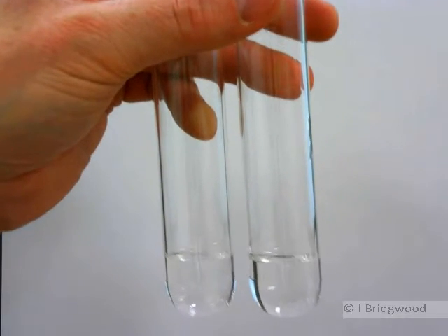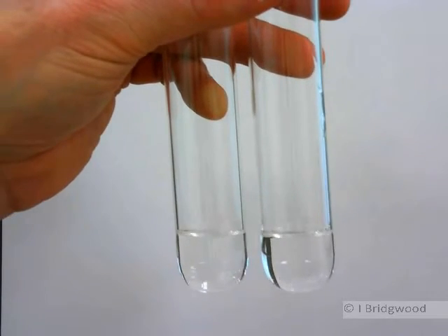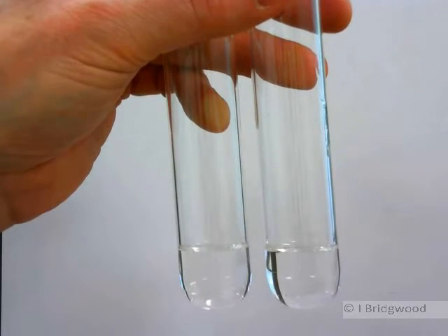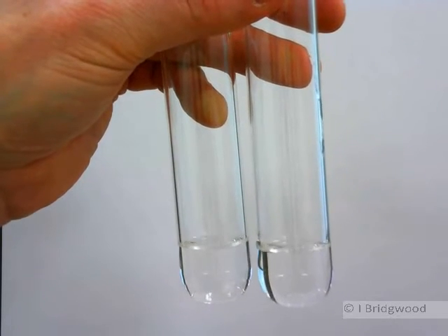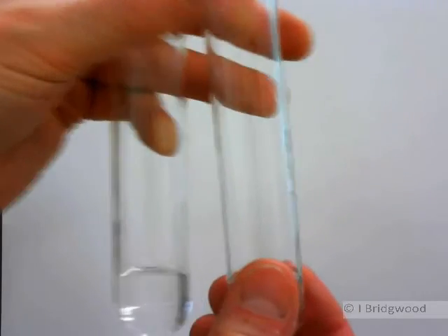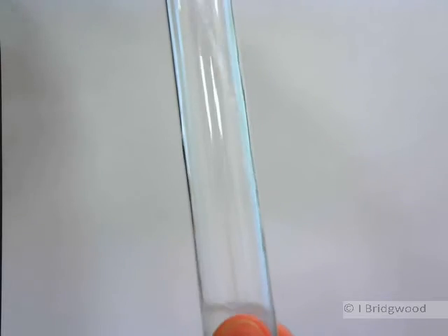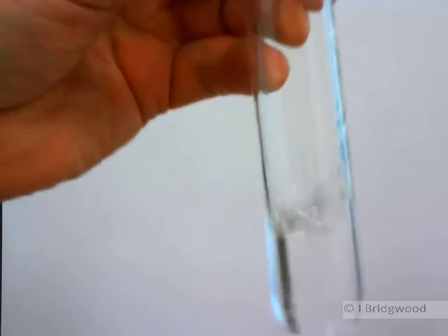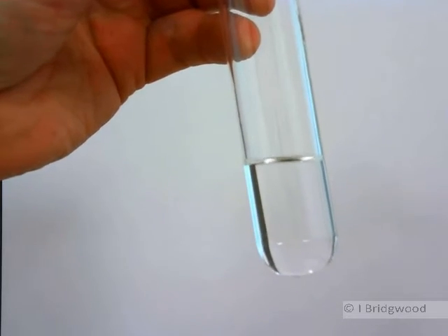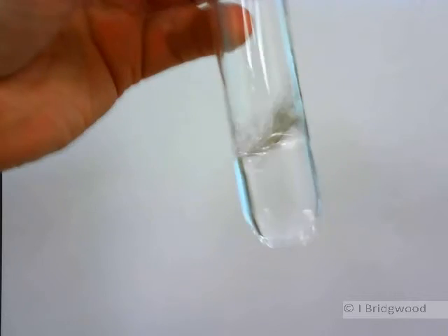Will it be possible for the van der Waals forces that we form between these molecules to overcome the energy involved in breaking the hydrogen bonds in the OH groups? Let's find out, shall we? If I mix the two... Well, look at that. Completely miscible.